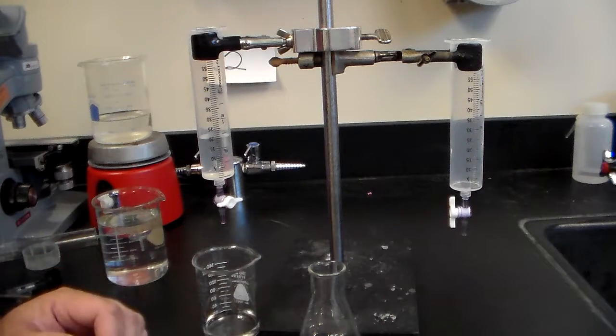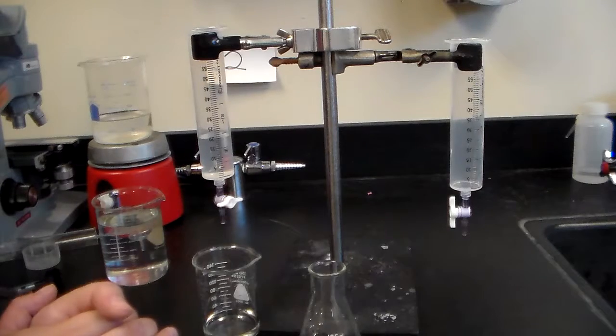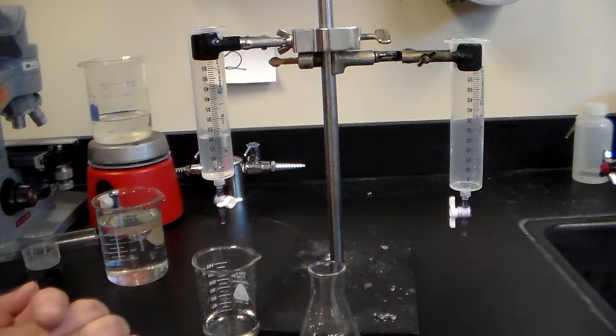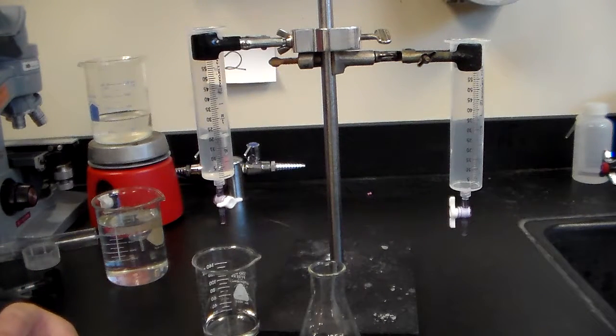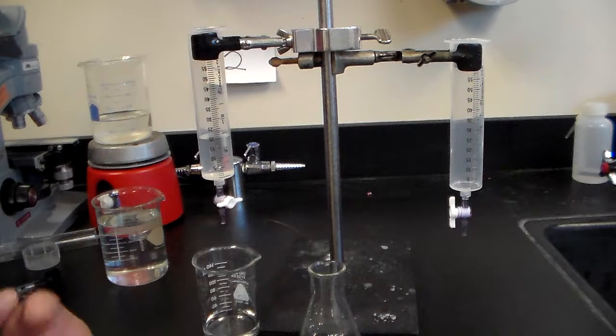Now you're ready for this burette. You're going to do the same thing with the other side. This is going to be important: you don't mix the acid and the base together in the same burette because that will mess up your results.